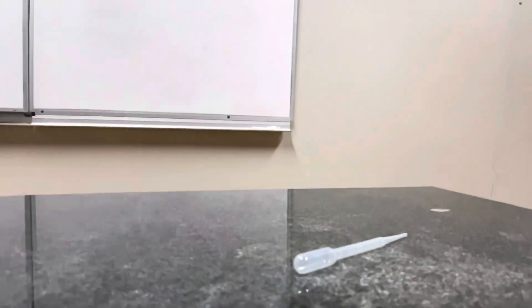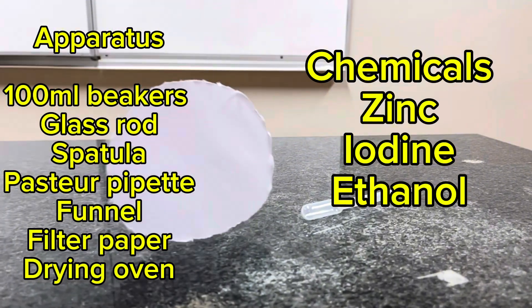The empirical formula of zinc iodide. These are the apparatus and chemicals.